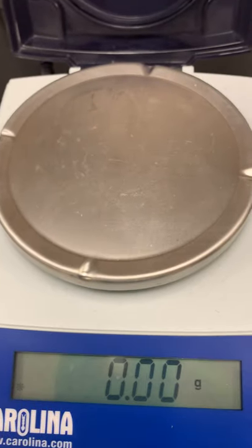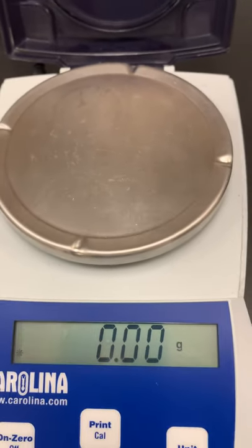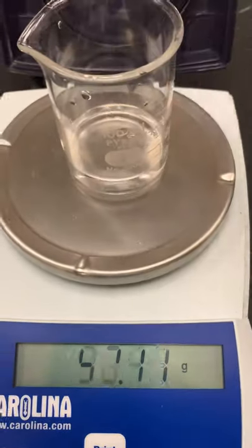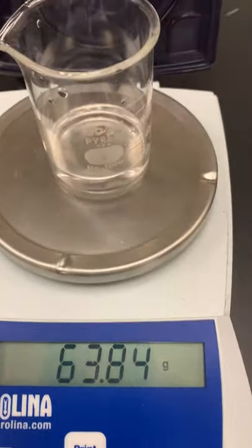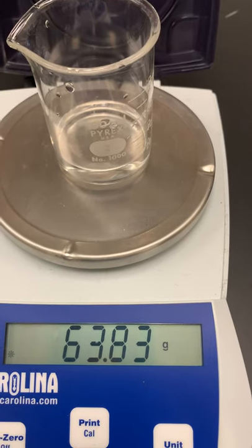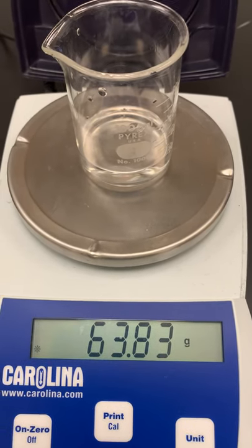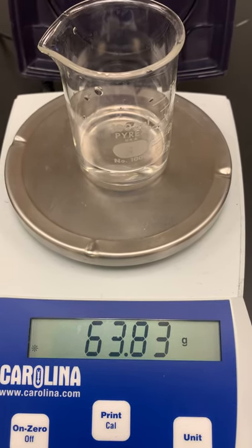After melting, the mass of the ice cubes and the beaker is 63.83 grams.